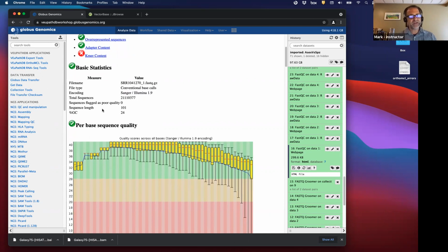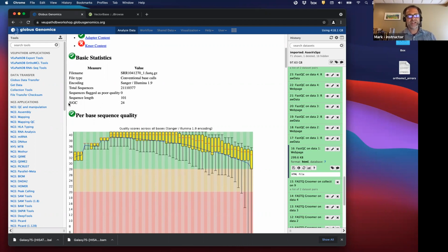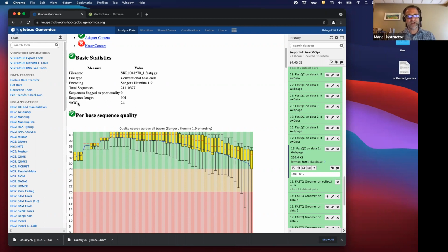Sequences flagged as poor quality: 0. Sequence length is 101. Usually you ask your sequencing core what sequencing length you want. It's actually been increasing as the technology has improved with Illumina sequencing, and it gets over 100, but it used to be pretty low, like 40 or 50 nucleotides for each read. But this one happened to be 101. And the percent GC content, you would expect it to be 50, but this, I believe, is Plasmodium, so it has a high AT content, so GC is correspondingly low.